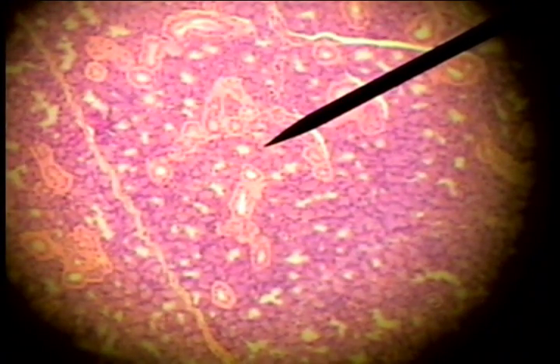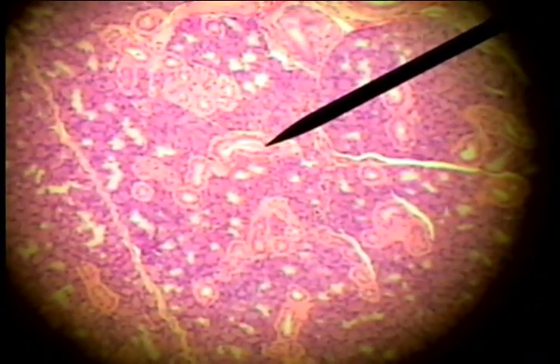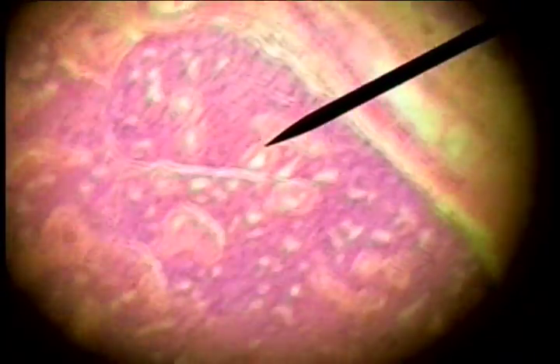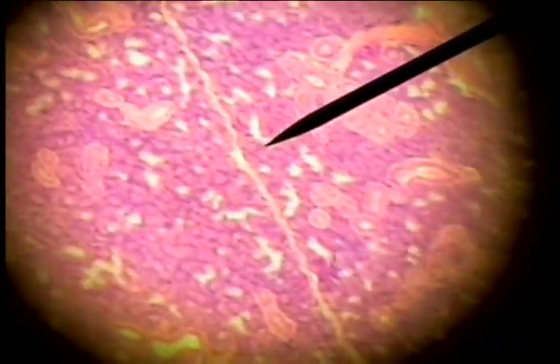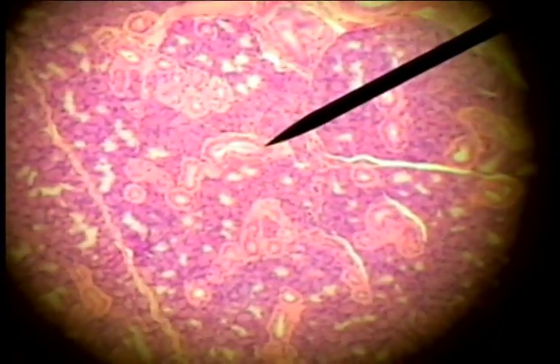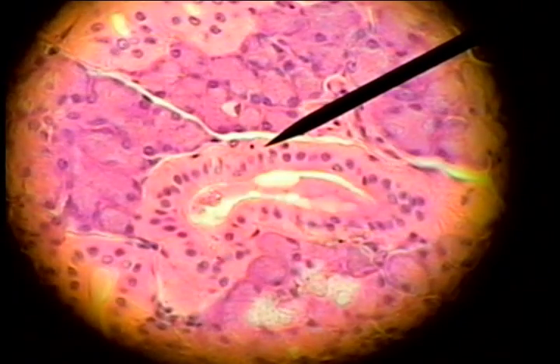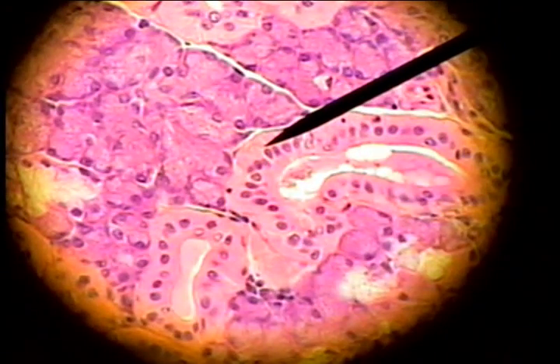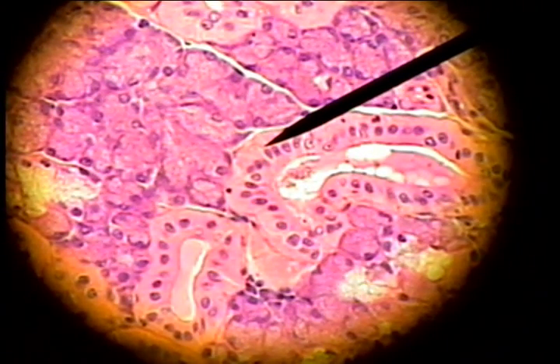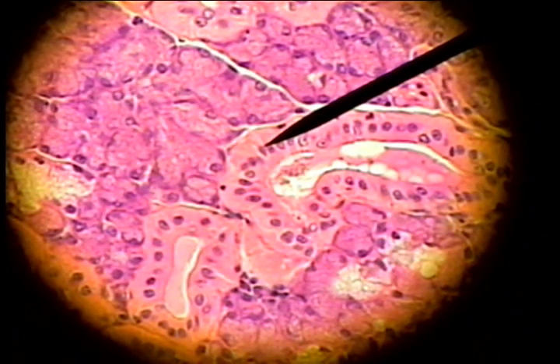Scanning back to find a larger duct — the larger ducts are usually lined with a columnar type epithelium. Looking at this duct here at higher power, the cell type is more like a columnar cell. Indeed, these cells are taller than they are wide, so these are the columnar cells of a large salivary gland duct.